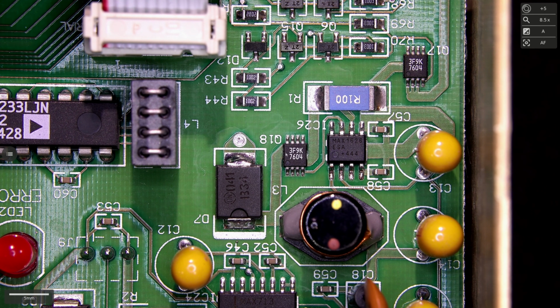So essentially, if you keep this MOSFET completely on, you have a direct path from the power supply through that and through the inductor and through everything else. So if there is a malfunction in the DC-DC converter, it is conceivable that it was just simply keeping this device on, which then we're trying to put 15 volts on a lot of devices that were rated for 5 volts because this is a 5 volt buck converter. So that could potentially have caused a cascade failure that can also explain why there is so much power supply draw.